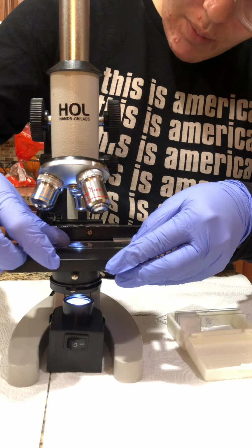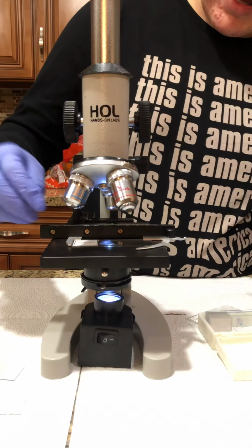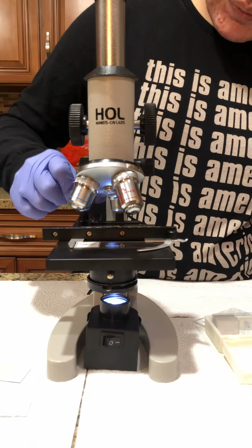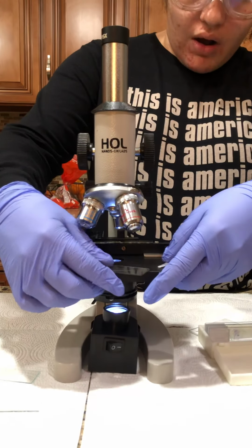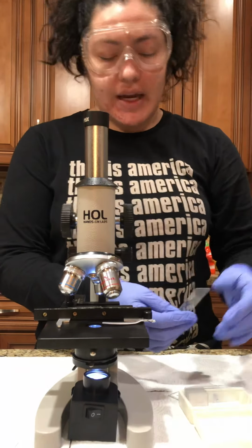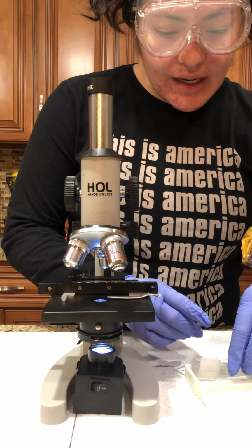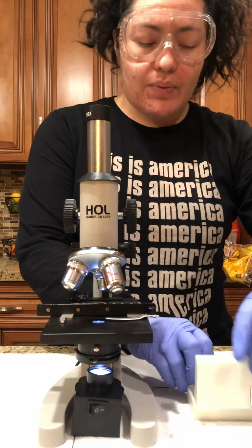It's called the whole mount. Just put it in there, and you see how that holds the slide, and move it around. Have my light on, move it around just to get a view, and then obviously I'll be looking through the lenses. I did that with all 7 slides, and then described what the letter E looked like on the different magnifications, and for the other 6 slides, noted what magnification sat best with each slide. All right, so that was part 1.